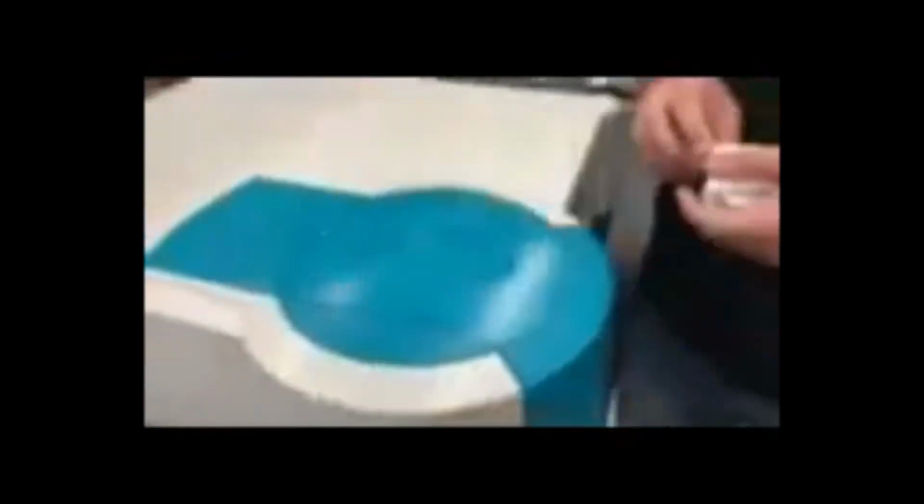To begin your time in the spectrophotometer room, begin by wiping both sides of the blank water cuvette before you go to zero it. Okay, he's putting it in, and now he's going to close the door and press 0 on the computer screen.